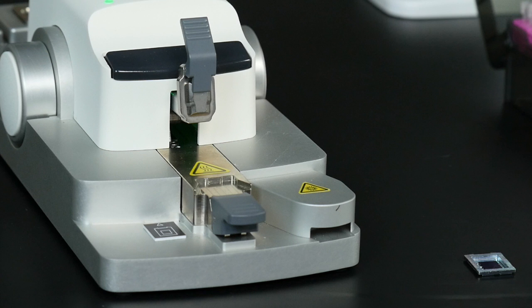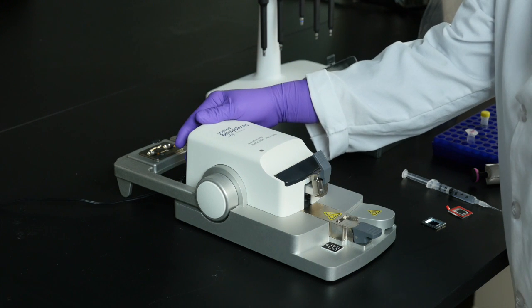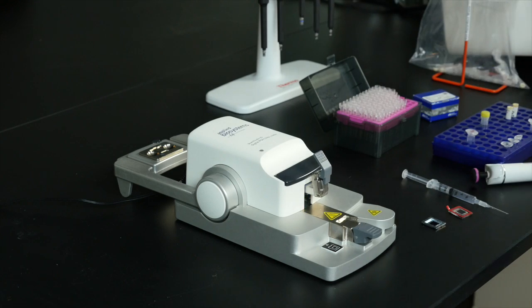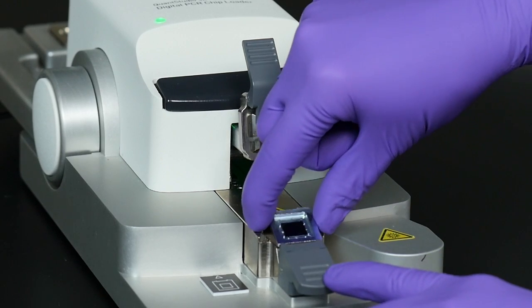After preparing your reaction mixture, you are now ready to load the sample using the automated chip loader. Turn on the loader and place the open chip onto the keyed chip nest, like this.